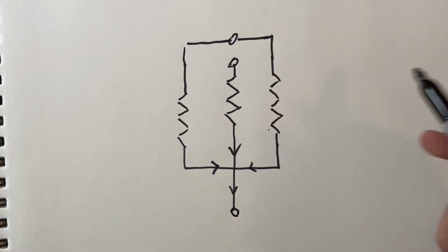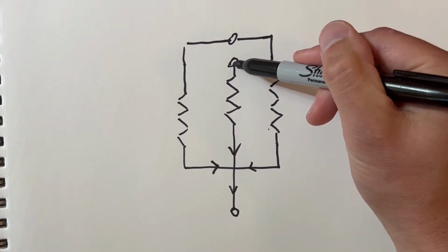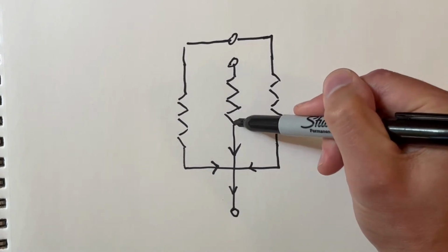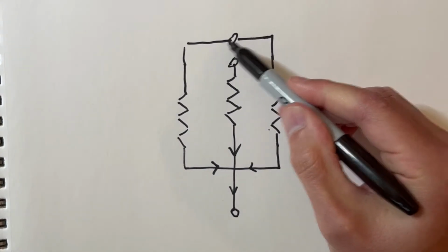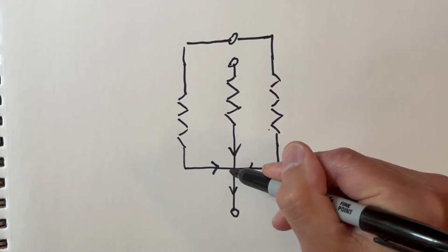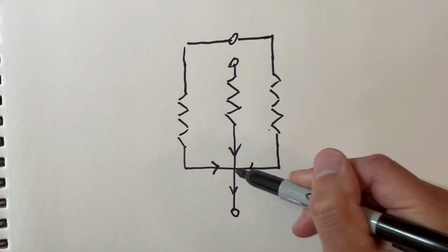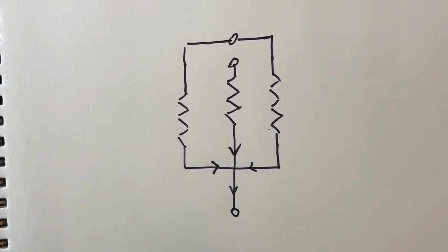Okay, so we've laid out our device. Once again, we have water coming in through our tube fitting in the central channel, which goes through the fluidic resistor and into the cross junction. And we have our oil inlet, which will split into two channels that then come into the side of our cross junction geometry. The droplets will form in the nozzle and then will flow into the outlet channel and out of the device through a final tubing fitting. Now that we have our device designed on paper, we are ready to make the transition into CAD.